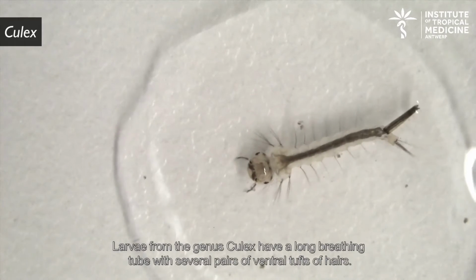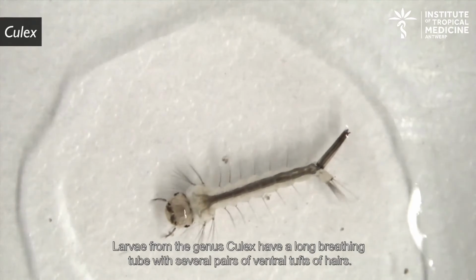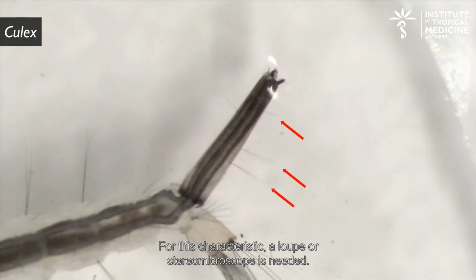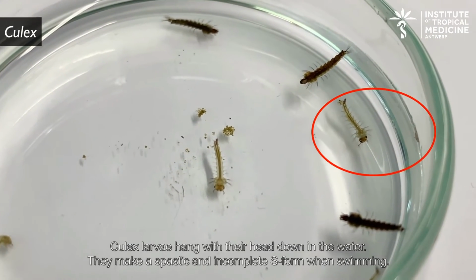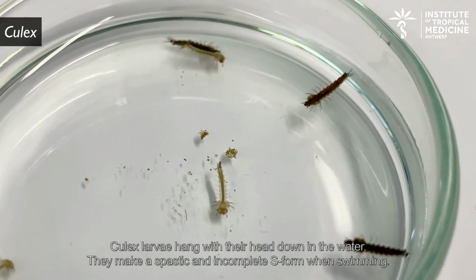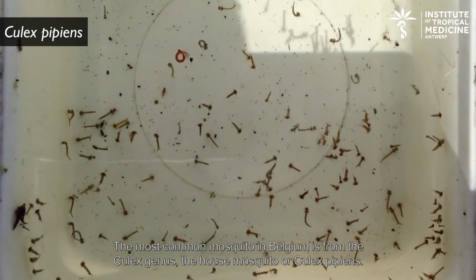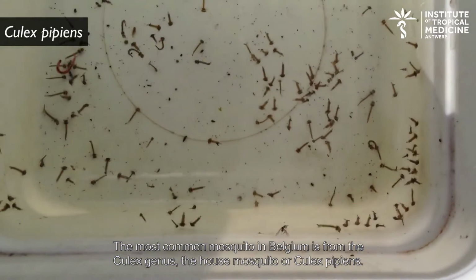Larvae from the genus Culex have a long breathing tube with several pairs of ventral tufts of hairs. For this characteristic, a loupe or stereo microscope is needed. Culex larvae hang with their head down in the water. They make a spastic and incomplete S form when swimming. The most common mosquito in Belgium is from the Culex genus, the house mosquito or Culex pipiens.